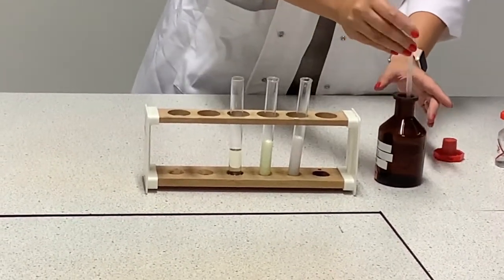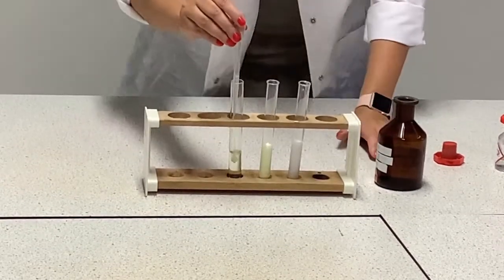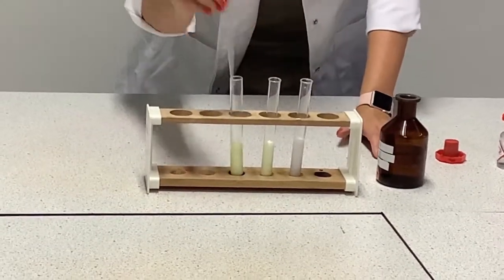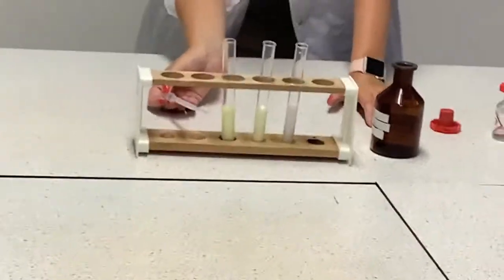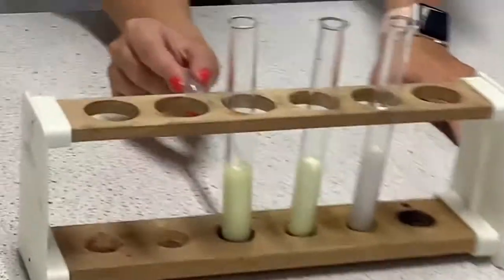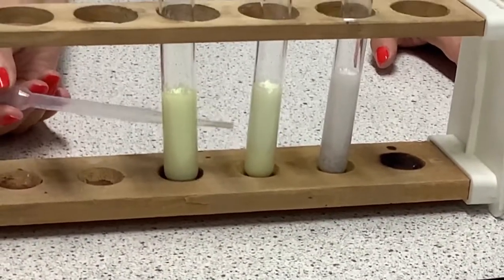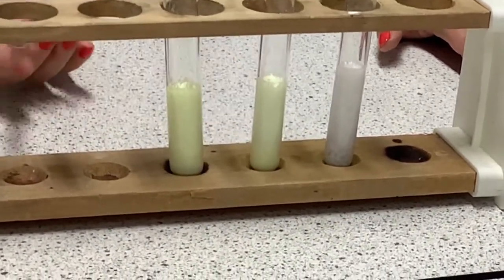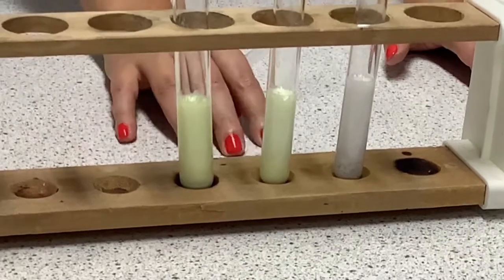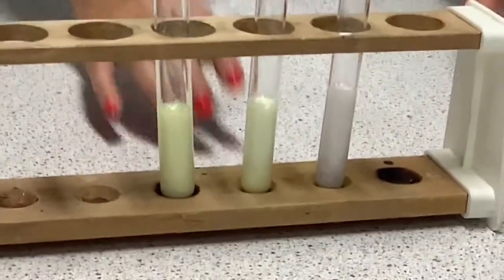Now let's add some silver nitrate to our iodide ions. Again we can see a precipitate has formed. It is slightly darker than the bromide precipitate and it's more yellow than cream. So that is the test I can do to identify my different halide ions.